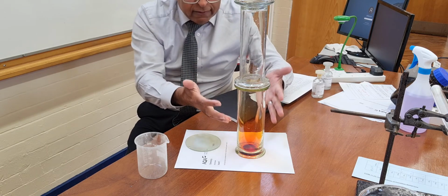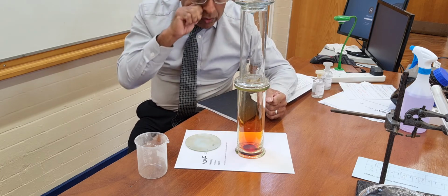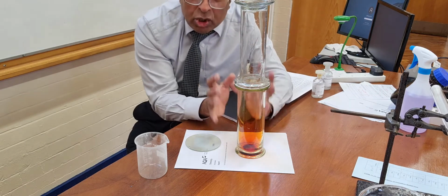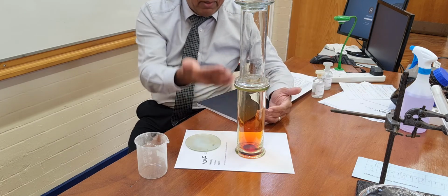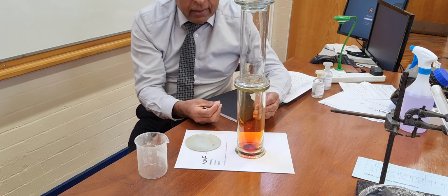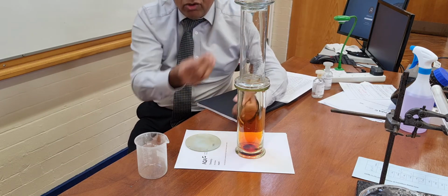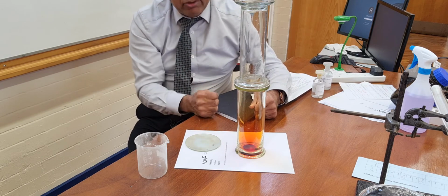Even though 24 litres of bromine gas would weigh 160 grams, and about 24 litres of air would weigh about 30 grams, bromine is much more dense. By normal logic, people would say, well, bromine should stay at the bottom being very dense. Well, because of diffusion, because the particles are moving, I do expect the brown colour to spread above because of the random movement. Even though the particles are heavy, some of them will knock against the air particles and end up in the gas jar that's above. So 3 demonstrations.